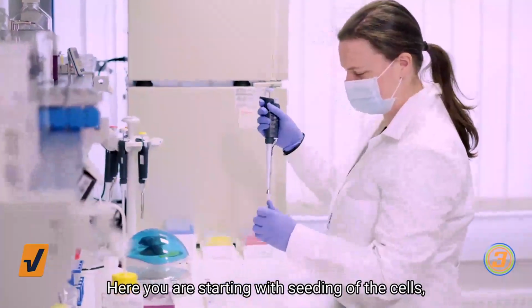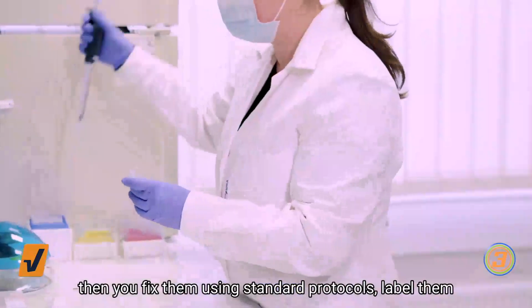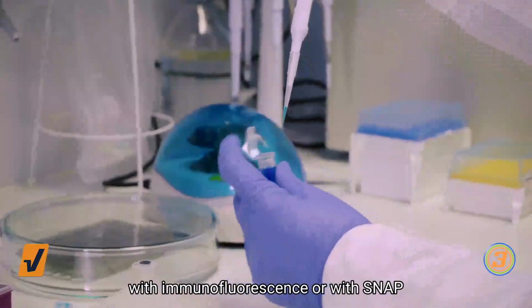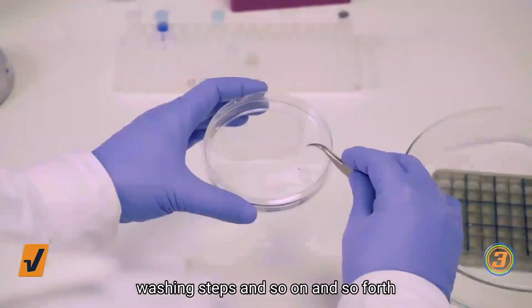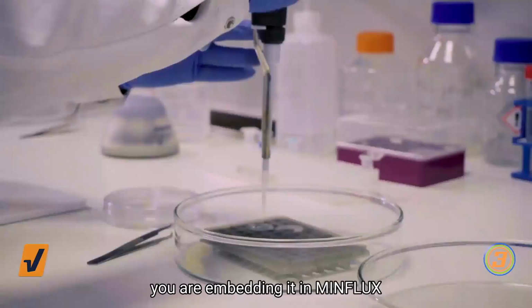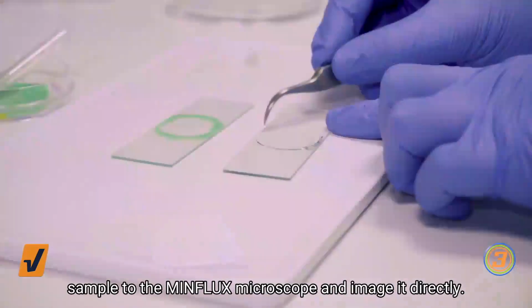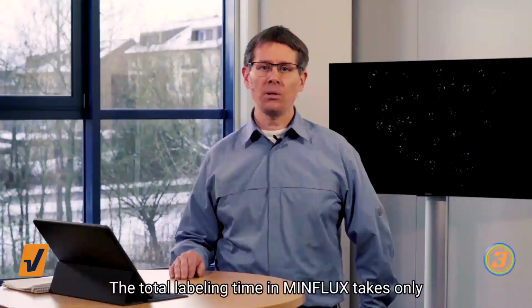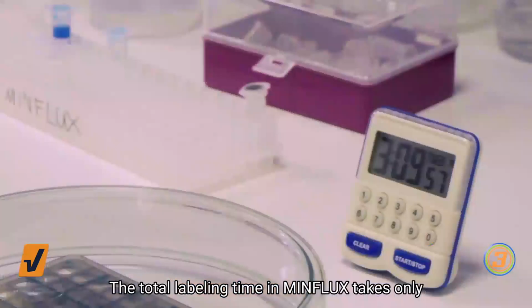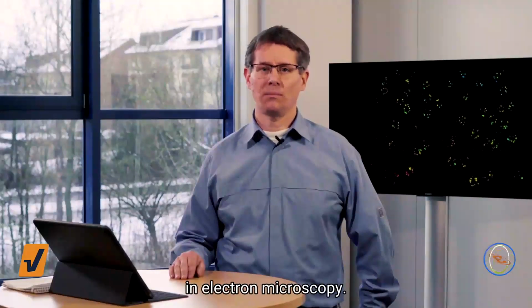Here you're starting with seeding of the cells, then you fix them using standard protocols, label them with immunofluorescence or with SNAP labeling, and ultimately, after washing steps and so on, you're embedding it in MINFLUX imaging buffer. Then you're ready to take the sample to the MINFLUX microscope and image it directly. The total labeling time in MINFLUX takes only a few hours in contrast to weeks in electron microscopy.